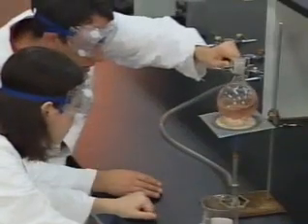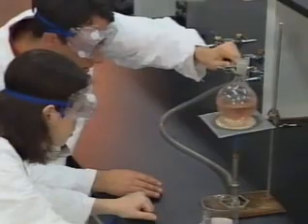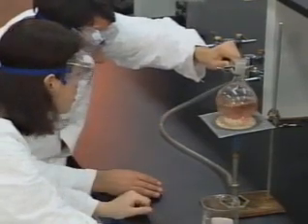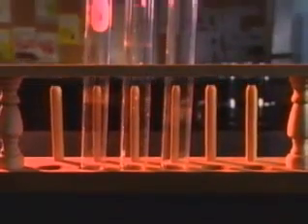I guess we should mention some other things about dealing with a burner. Well, yeah, like if you're heating chemicals in a test tube or anything else, make sure the open end isn't pointing at you or anyone else, because it could shoot out like Old Faithful. And one more thing, Mia. Do you know how to tell hot glass from cold glass just by looking at it? I'm afraid I don't. Well, you shouldn't be afraid, but you should be cautious, because you can't tell by looking at it. Hot glass looks just like cold glass. Be careful. I didn't mean I was afraid, but... I know what you meant.